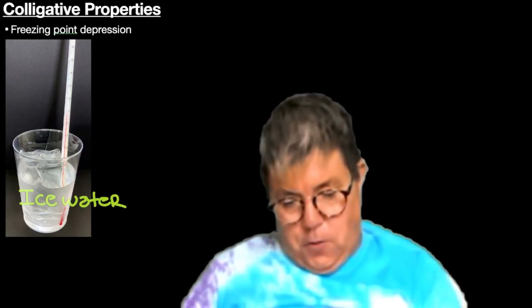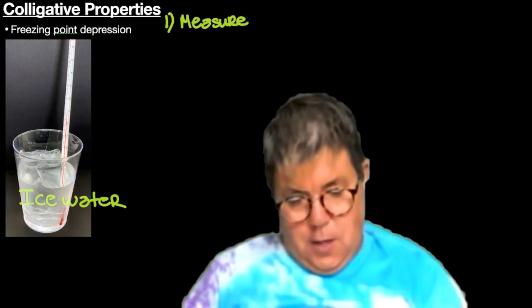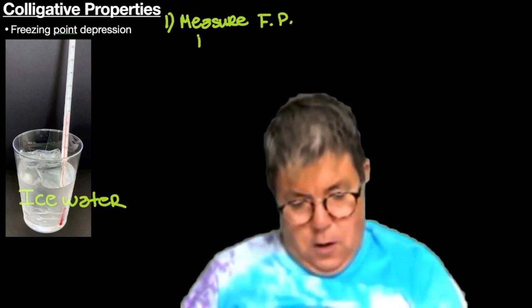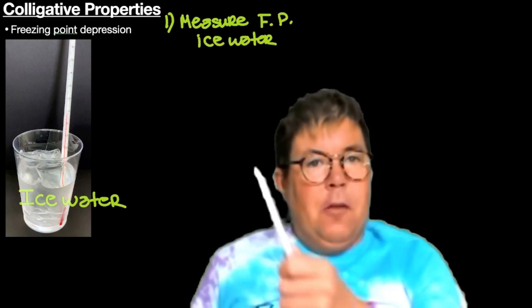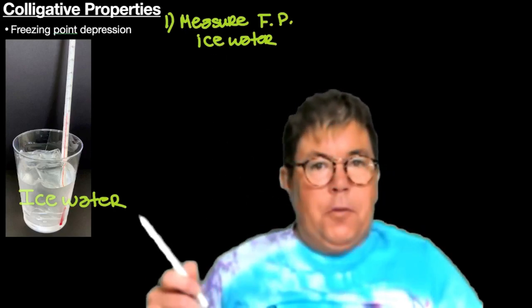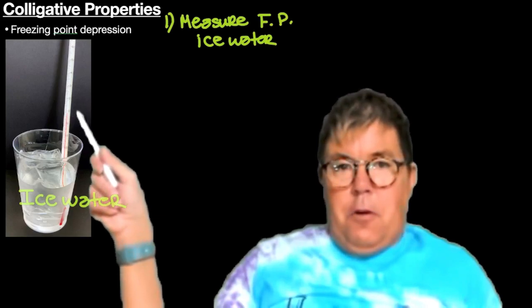First, you're going to measure the freezing point of ice water. When we measure the freezing point of ice water, what we are going to look for is the lowest reading on the thermometer.